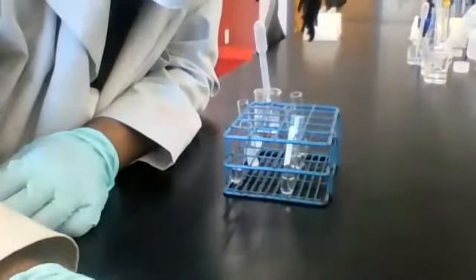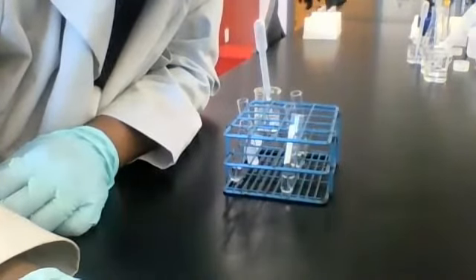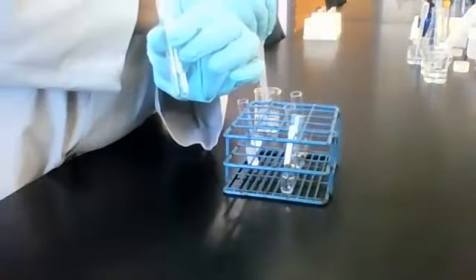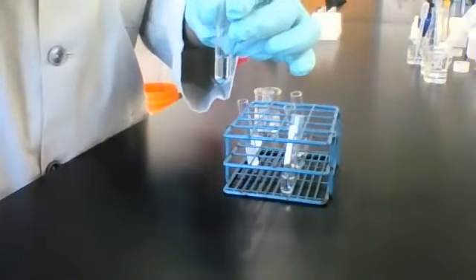All right, so we're almost done going across that last row of the table in part B. Let's keep going. Solution 3. Let's add some reagent C and see what happens.